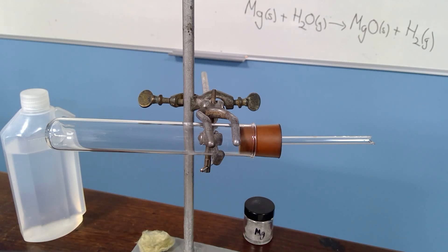This is a demonstration of the reaction between magnesium powder and steam. It is a reaction that has relevance at GCSE in terms of the reactivity series of metals and also at A-level when looking at the properties of group 2 elements.